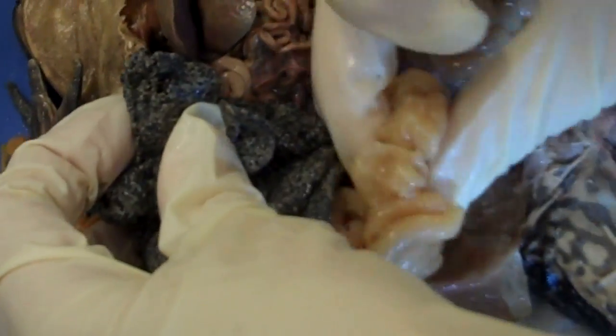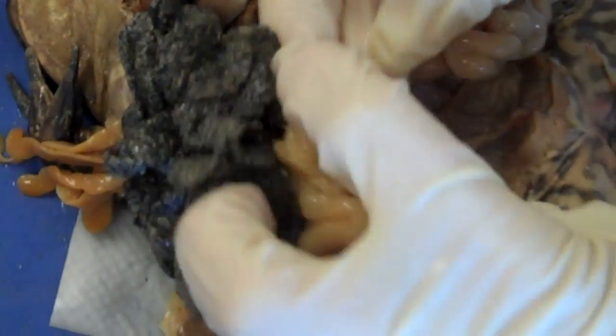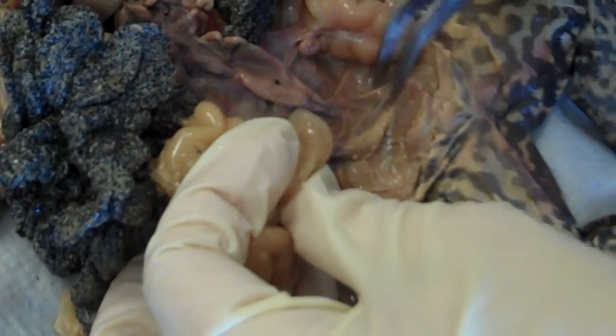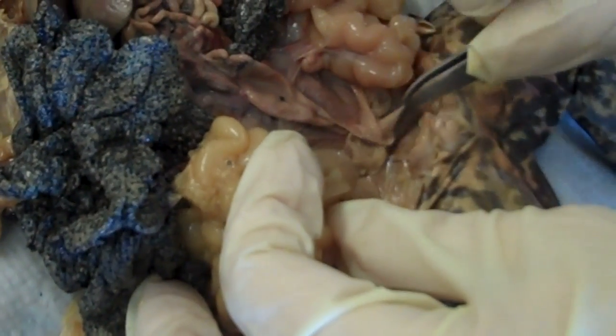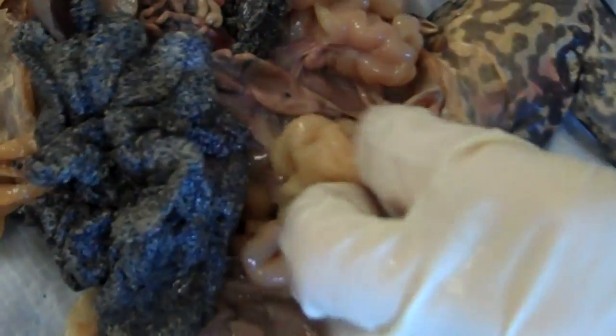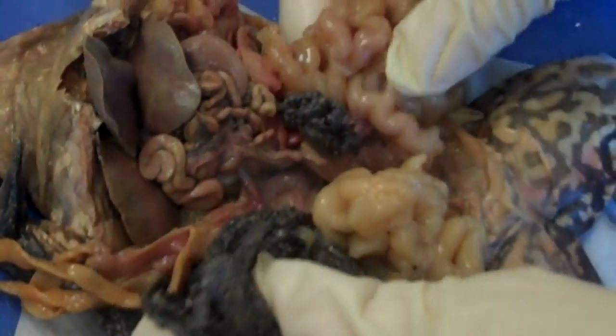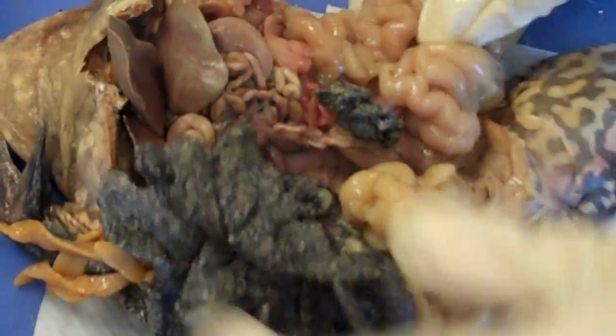On the other side, you have the same thing. These ovaries are just gigantic and filled with eggs — it's a gravid ovary. The fat bodies are attached to the ovaries, ovaries to the oviduct, oviduct to the ova sac or uterus. In the center, you have the urinary bladder. The kidneys are back there, but I would definitely show them to you on the male instead, because they're so hard to see on the female.